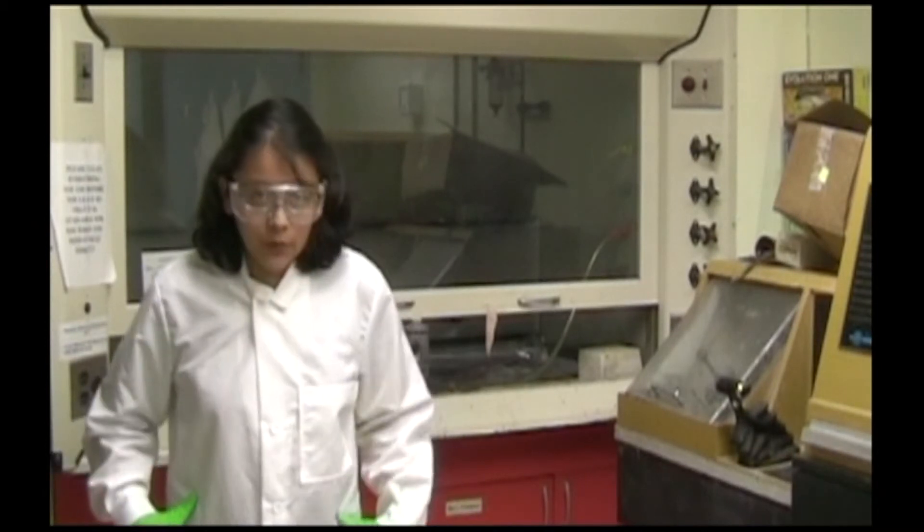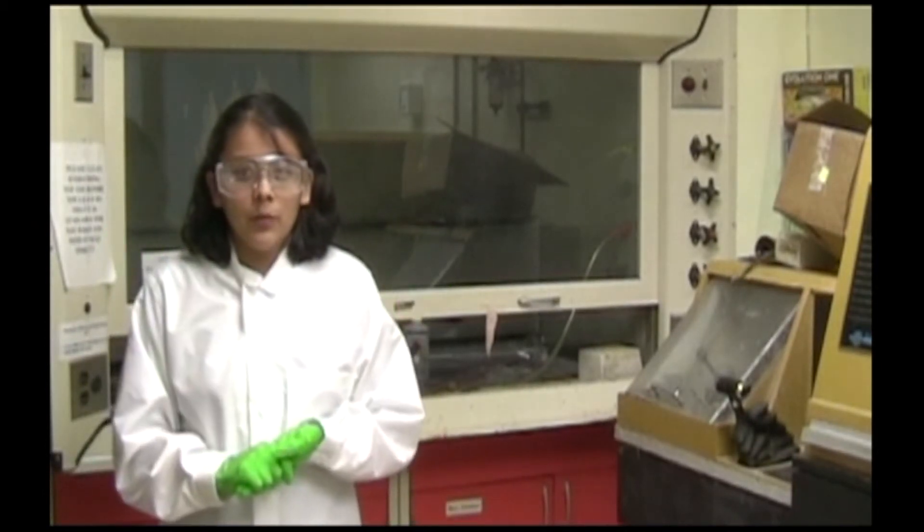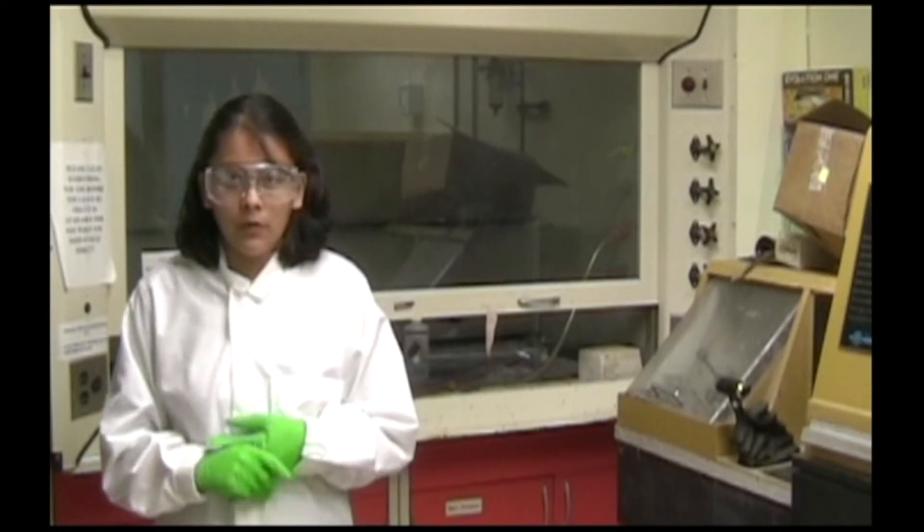When you're etching, please wear a fluid-resistant lab coat, safety glasses, and proper gloves. You may need to read the MSDS or material safety data sheet for the chemicals you are using in order to find out what the proper gloves are.